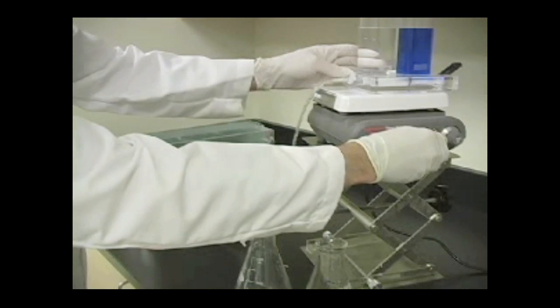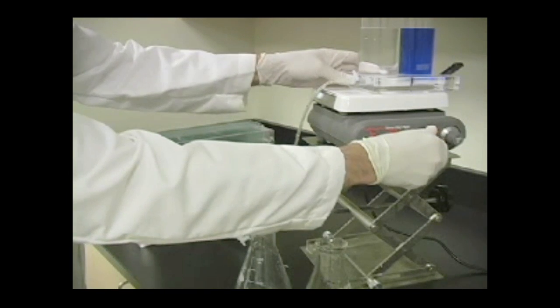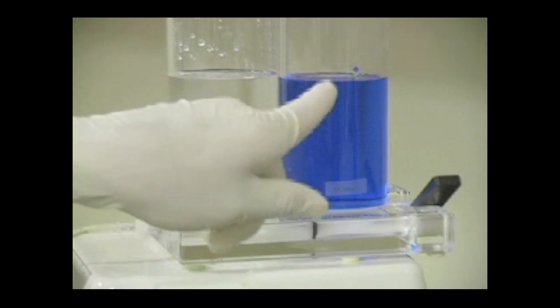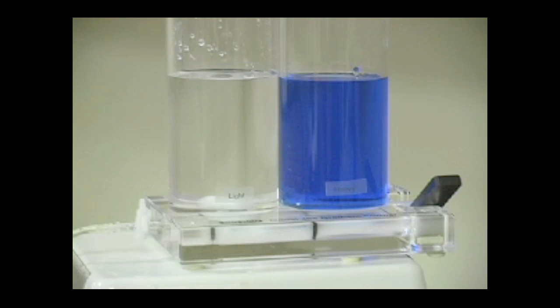Start the stir plate and adjust the speed so that you get good mixing. Notice that the level of the light solution should be slightly higher than the heavy solution.